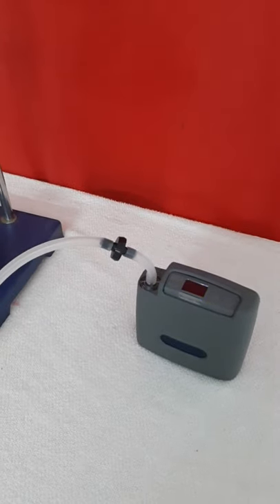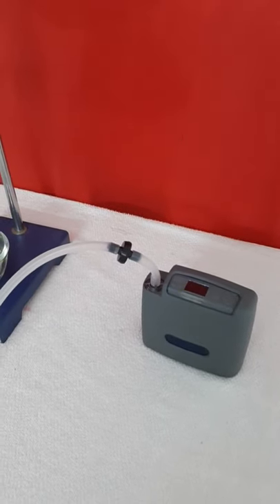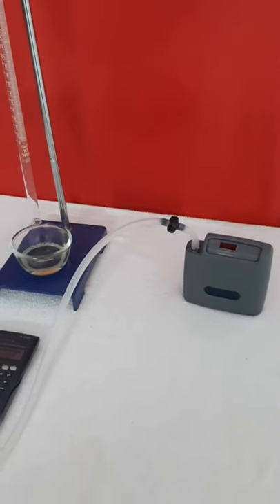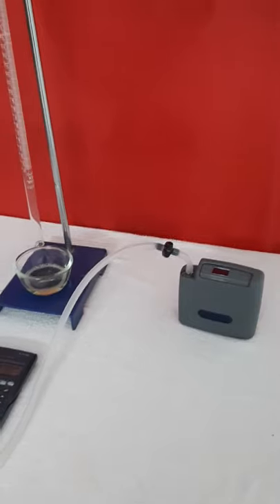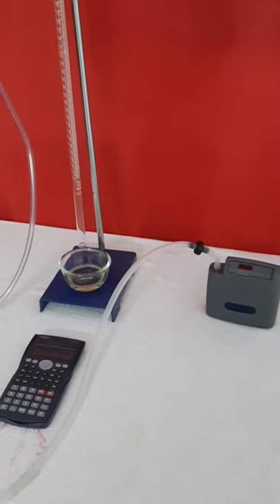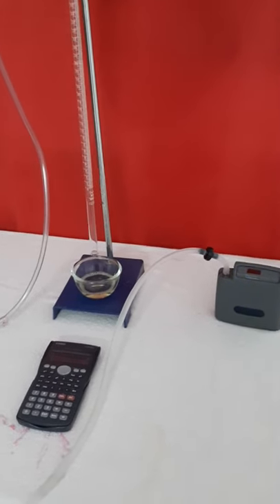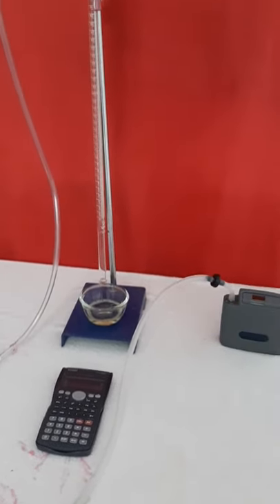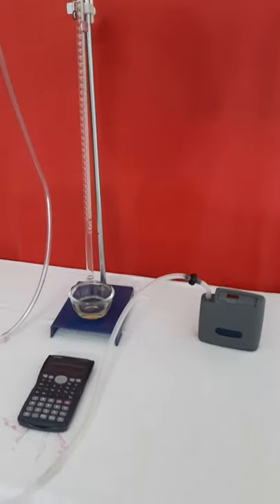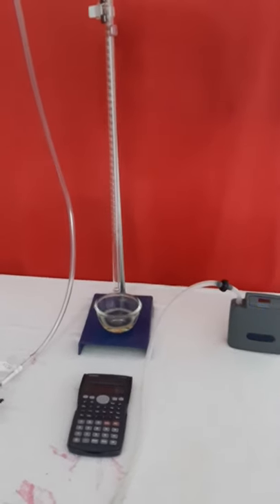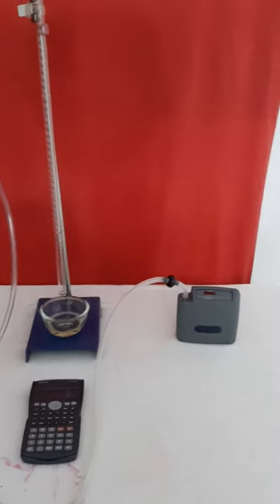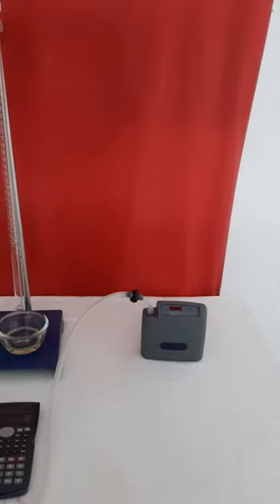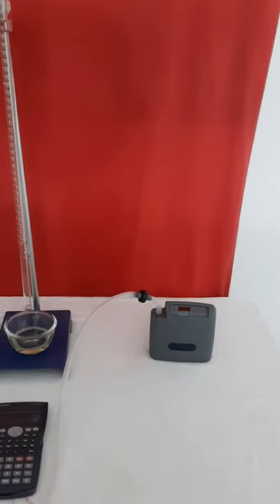Hi, this is Shrenik. Today I'm going to explain how to calibrate an industrial hygiene personal air sampling pump using a soap bubble meter. What I have here is a high flow air sampling pump made by Casella.